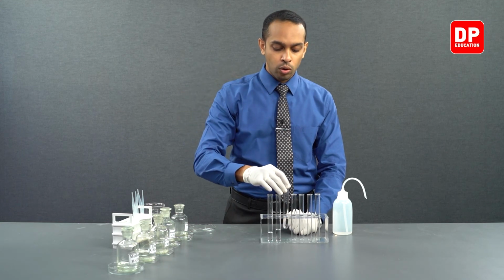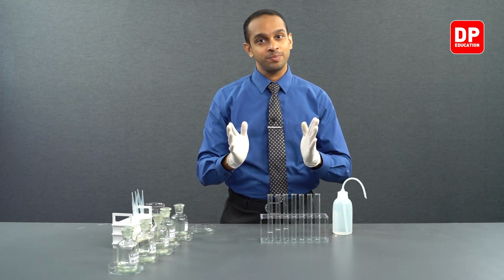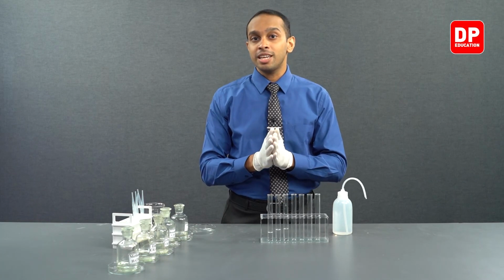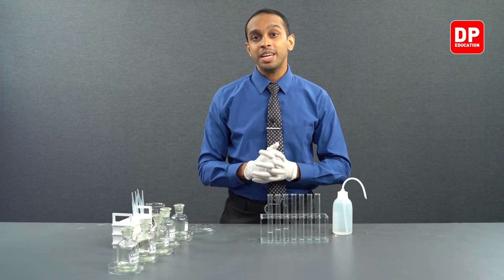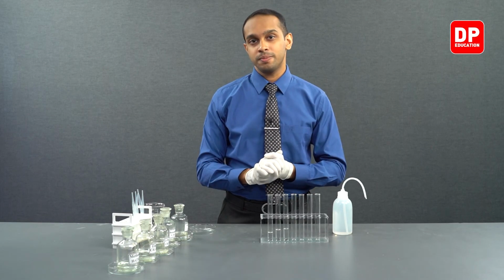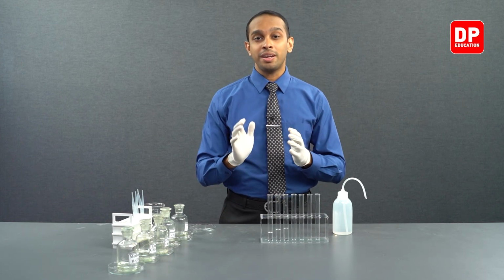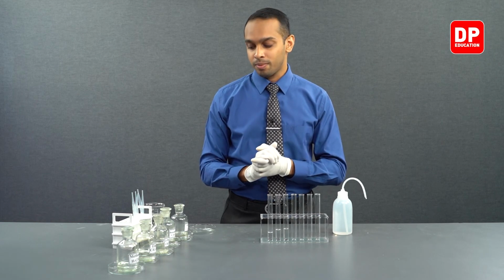So does that mean all the ketones are soluble in water? Again, not necessarily. Short chain ketones are soluble in water just like aldehydes, and when the carbon chain is longer, the ketones will become insoluble in water. Keeping that in mind, let's move on to an aromatic aldehyde, benzaldehyde.